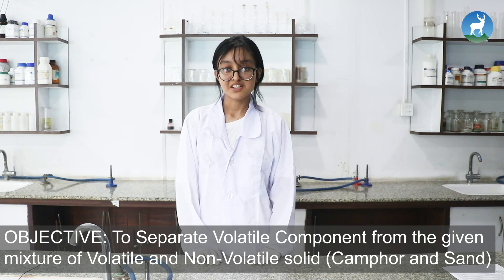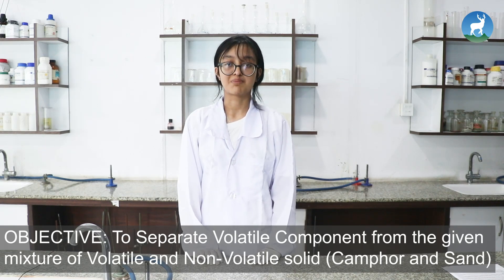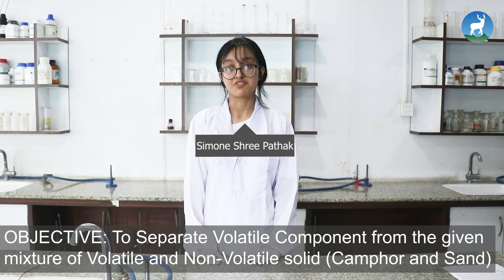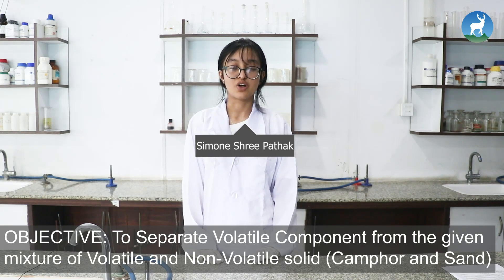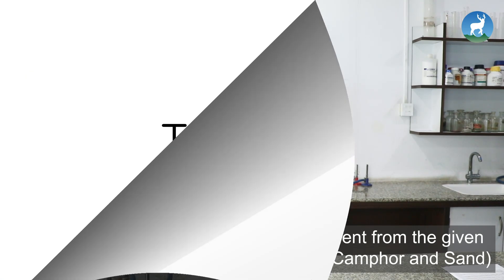The objective of this experiment is to separate the volatile component from the given mixture of volatile and non-volatile solids.